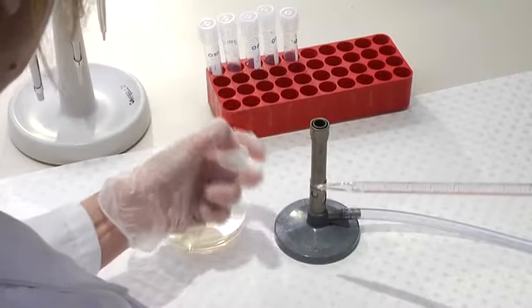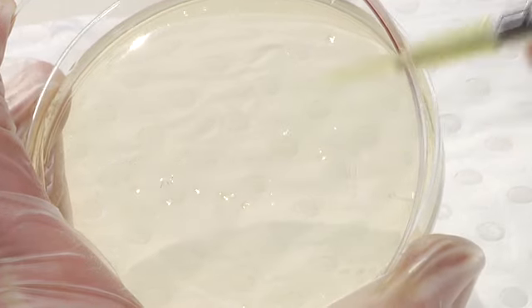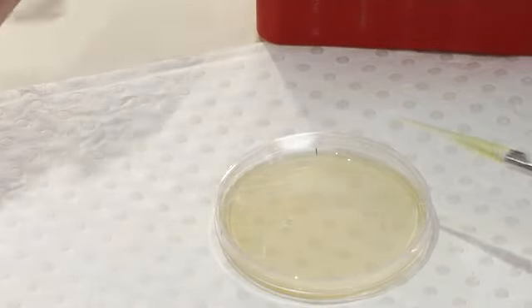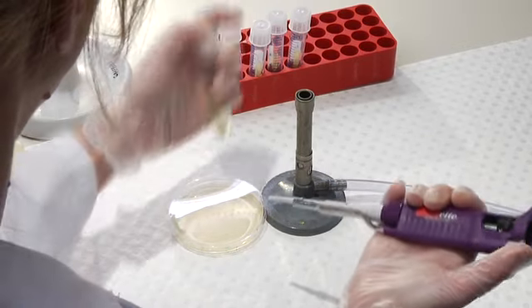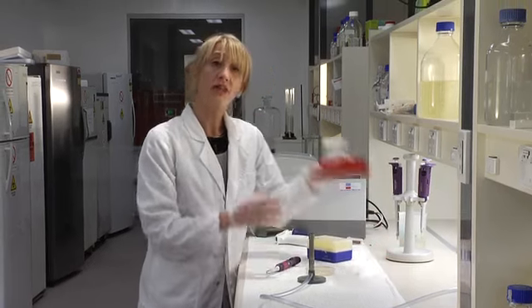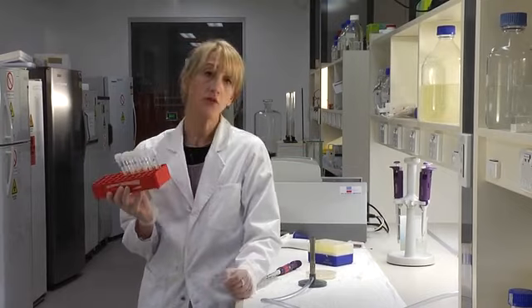And then to each tube, I'm going to add a single colony. So, now each tube contains a single colony. I'll just take them to the incubator and let them grow overnight.